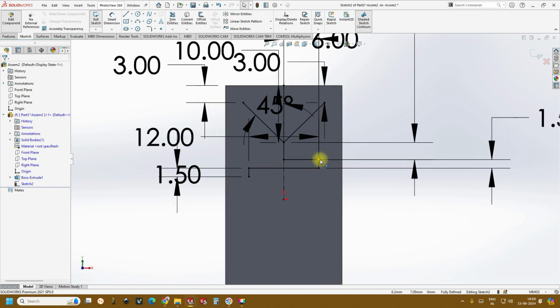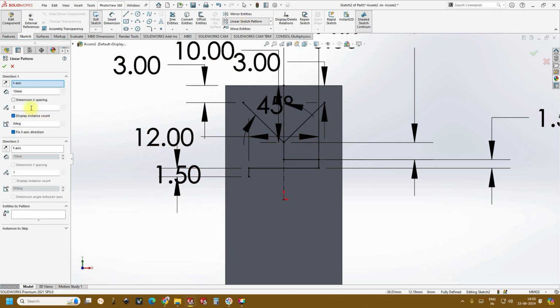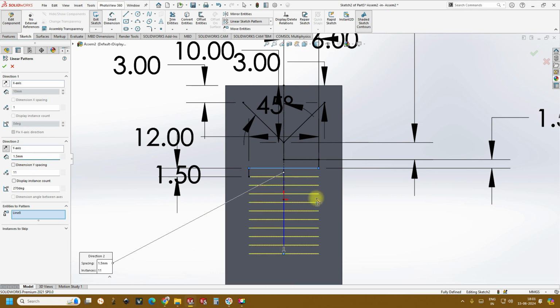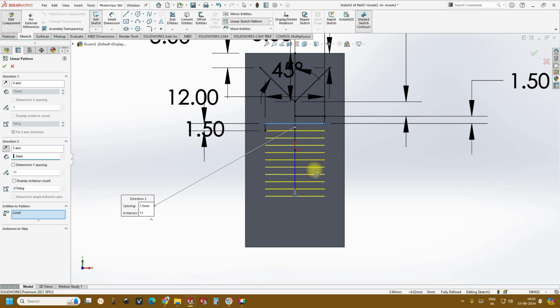So now we have created these 3-4 lines. After that, just go to linear sketch, and we don't want the x direction, reduce it to 1, and now we want the lines in the y direction. So before that, select the entities. This line we want to be in the y direction. The count, if you want 10 channels, create one extra, and the distance between two lines is 1.5 mm. So you see we have got the beautiful lines here. Okay, and then you can click OK.